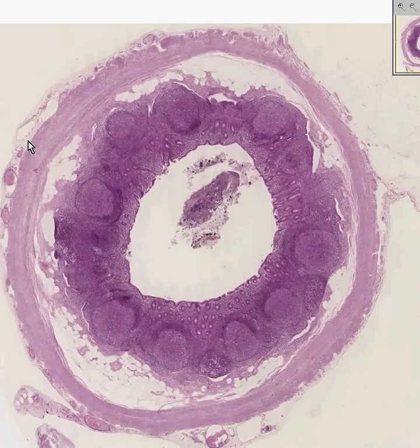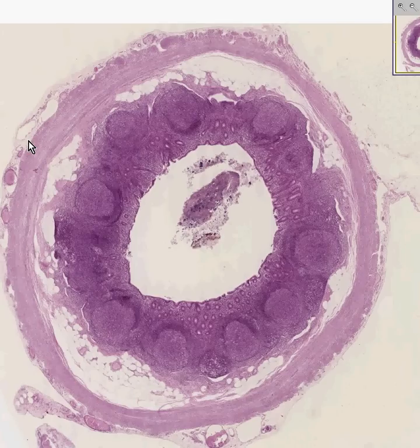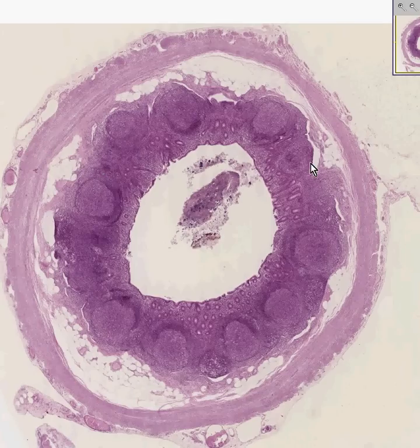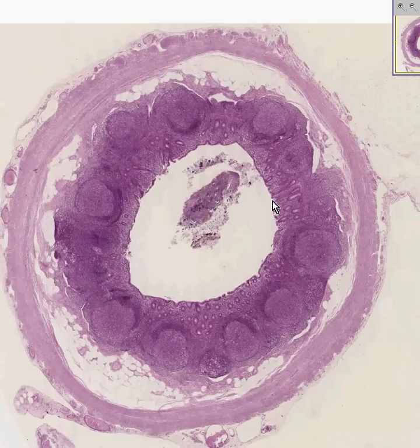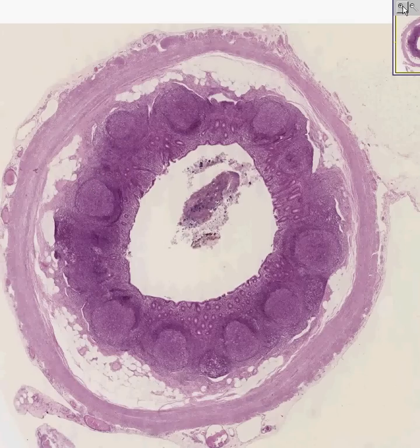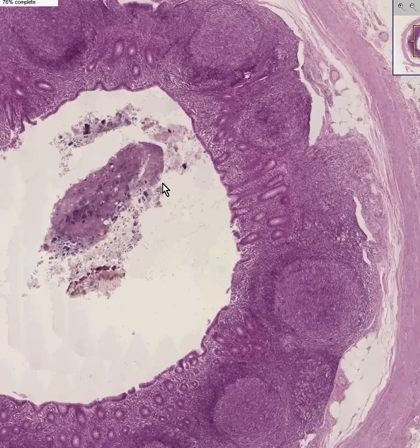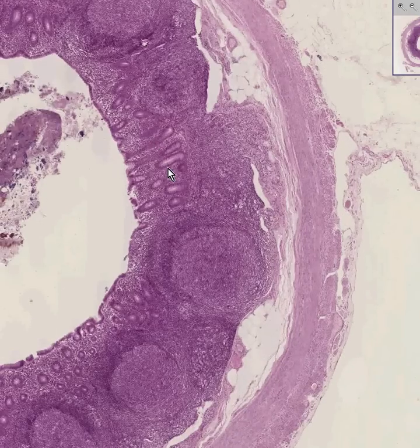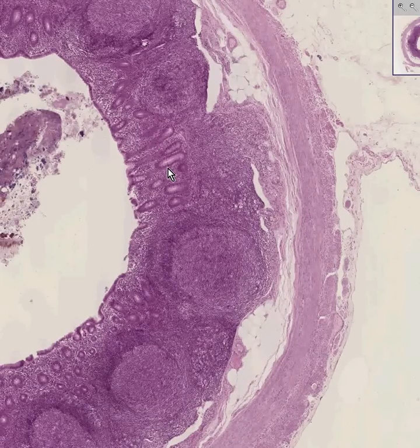Here is the world's most normal-looking appendix, for reasons we will soon describe. If a surgeon took out a lot of these appendixes and they looked like this, he would eventually get into trouble because he would be taking out normal appendices. Let's look at the salient features of a normal appendix in its perspective as a classical, typical example of just about any part of the GI tract.